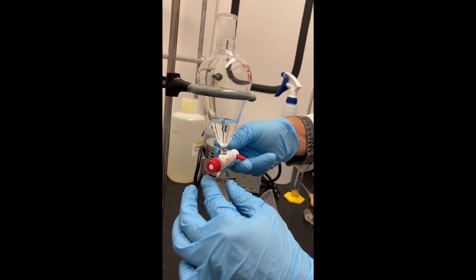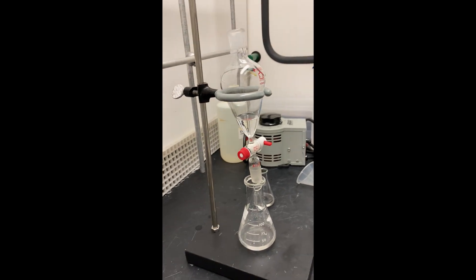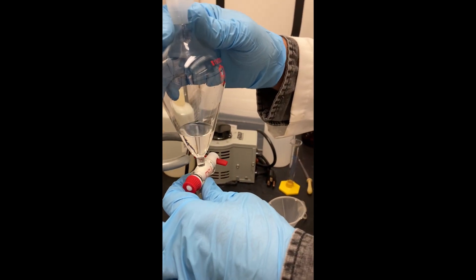Once you pour off your aqueous layer, go ahead and combine the organic layer with the previous extraction's organic layer.